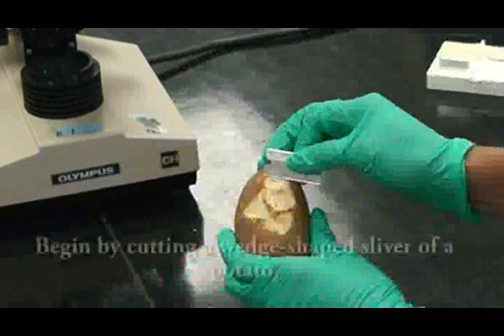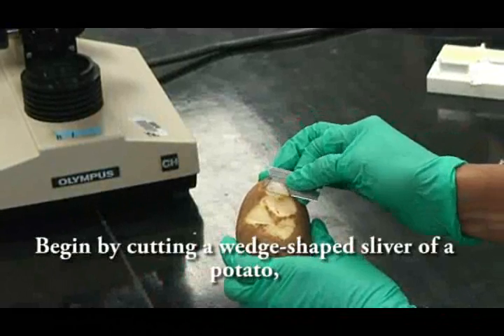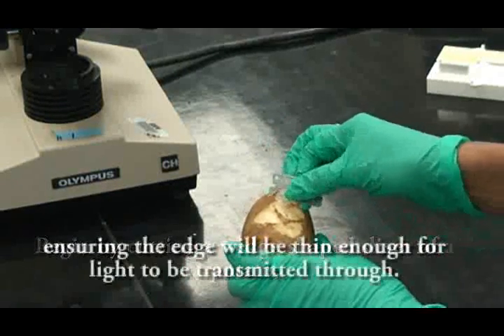Begin by cutting a wedge-shaped sliver of a potato, ensuring that the edge will be thin enough for light to be transmitted through.